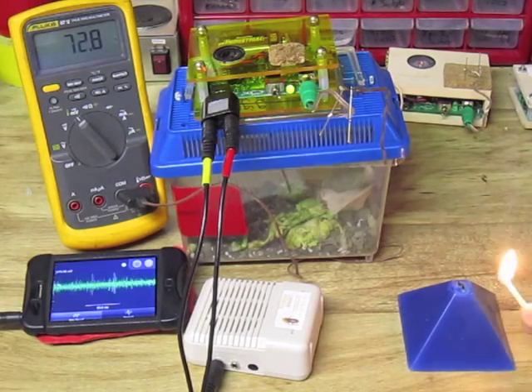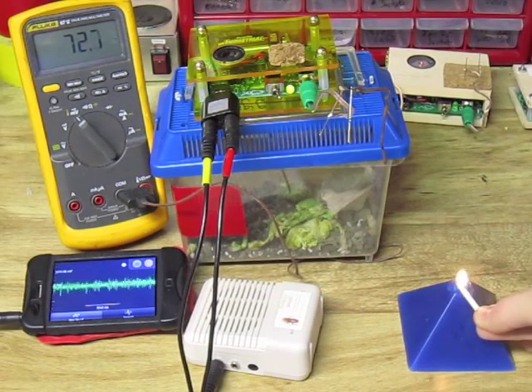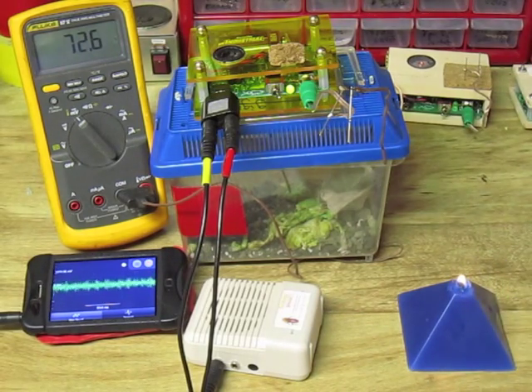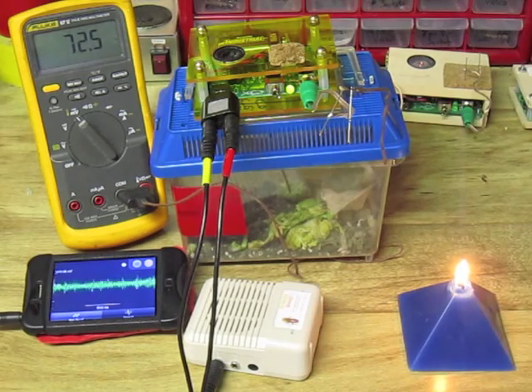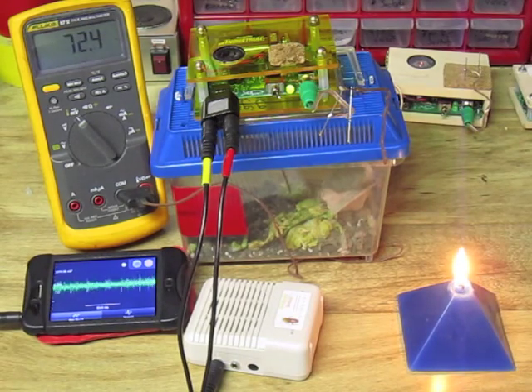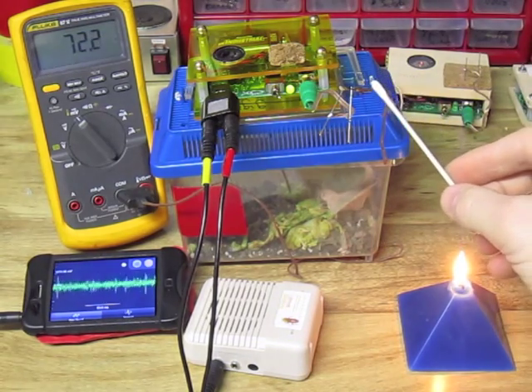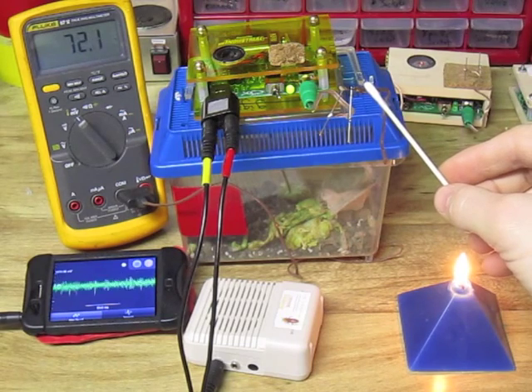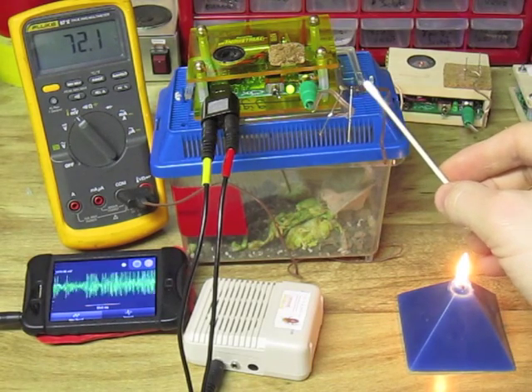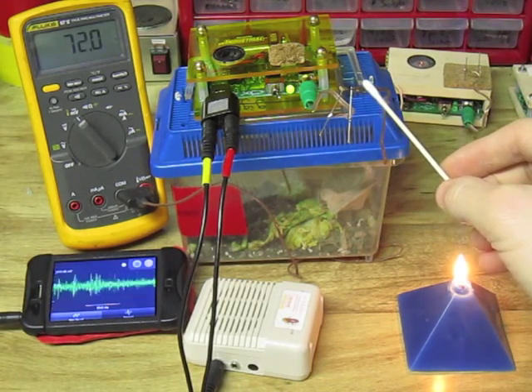Now what if I heat the cockroach leg above room temperature? Is there a temperature at which the neurons will stop firing? I have lit a candle and placed it to the side, but I will first check to see if I get a nice evoked discharge at room temperature — and indeed I do.